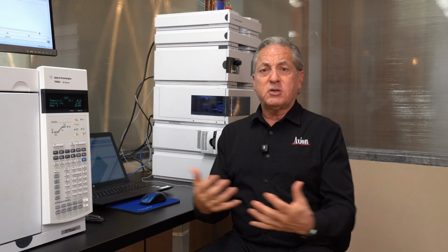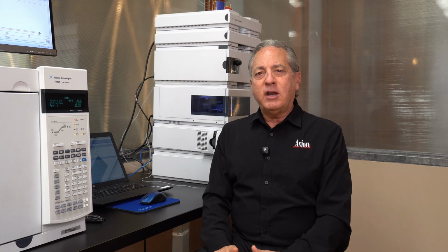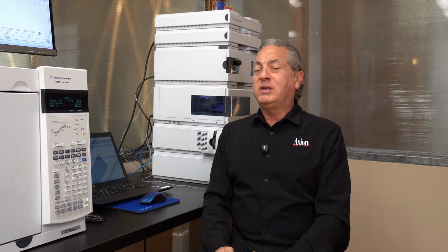So let's go ahead and set up the GC. I'm going to teach you how to listen to your sample. So we're going to have to find this set of temperature conditions. We need to find out what temperature we start at, what temperature we end up with, how quickly we go from initial to final. And those sound like they're complicated questions, but the sample will tell you the answer to them.